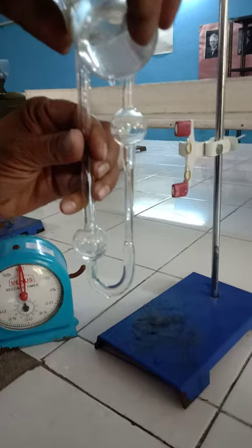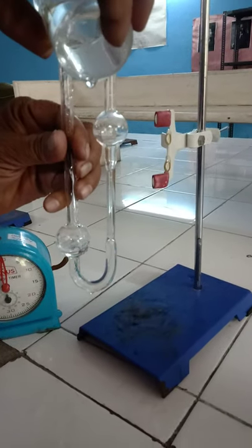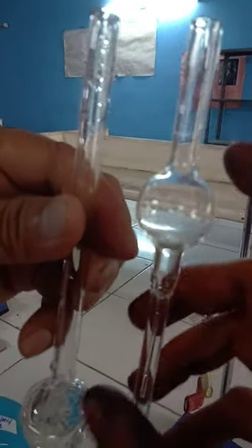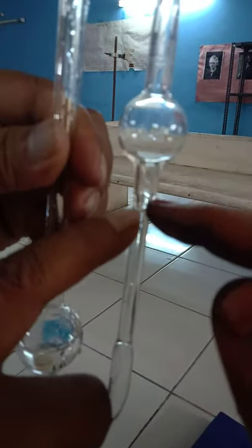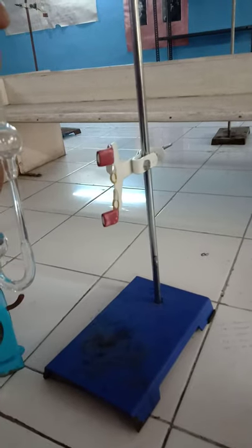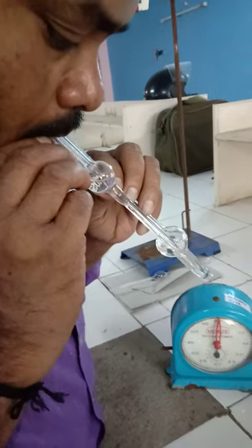Bulb B consists of two marks — an upper mark and a lower mark. Whenever bulb B is half filled, we should suck that water up to the upper mark. Whenever it reaches the upper mark, we should leave our finger. Suck the water up to the upper mark like this.